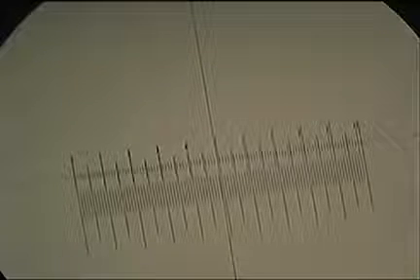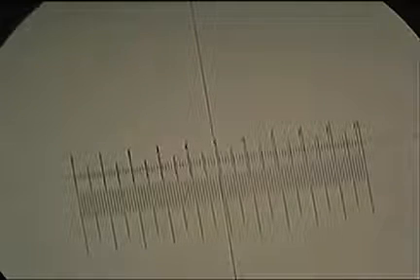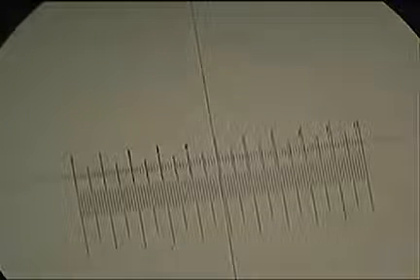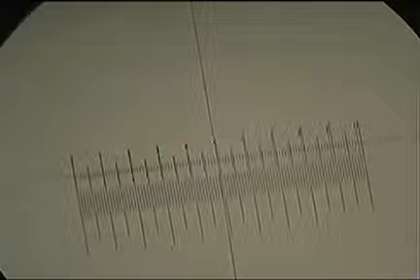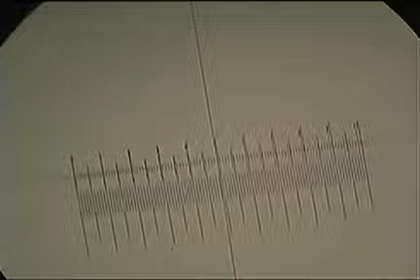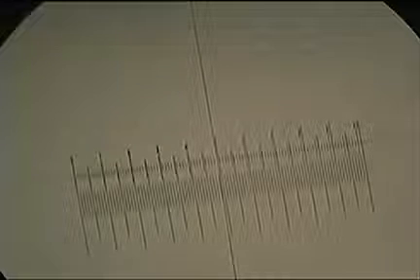That gives us, so that means each unit on the eyepiece graticule, from the 0 to the 1 on that top scale, is equivalent to 0.099 millimeters. Alright, so just under 0.1 millimeters. Now we can actually use the eyepiece graticule to measure cells, but we have to remember this is only at this magnification.